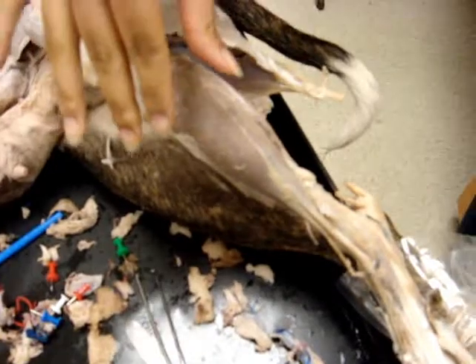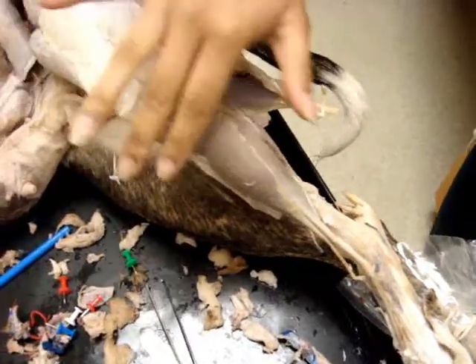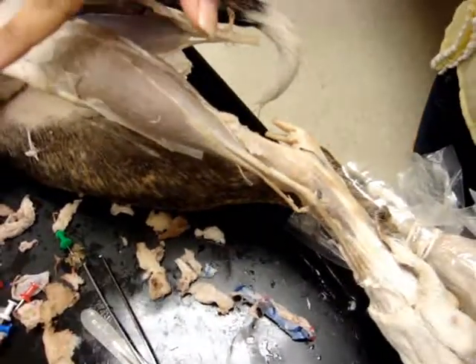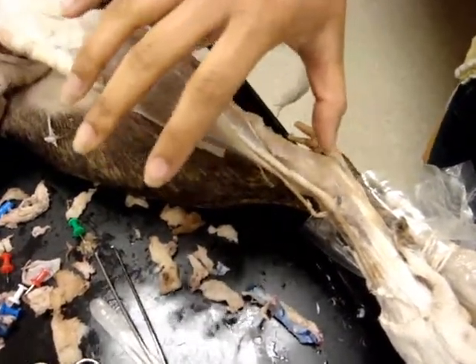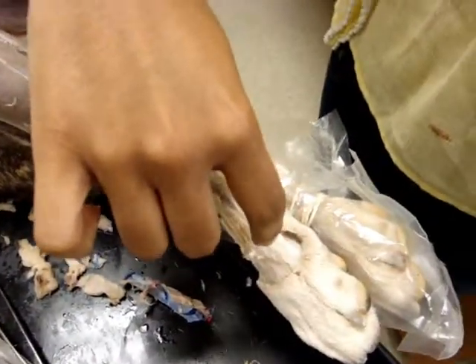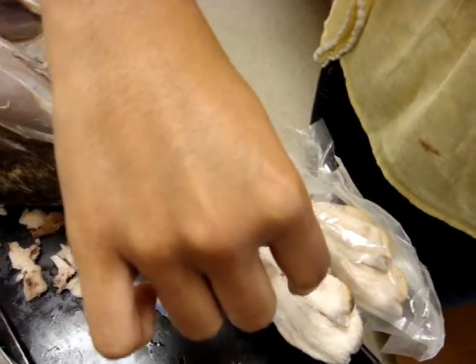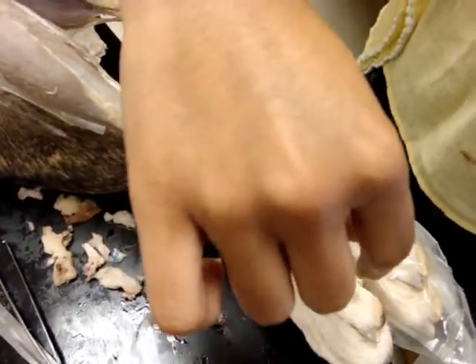We have now moved down to the crus, or the lower leg. The lower leg is covered with superficial fascia — specifically the superficial crural, tarsal, metatarsal, and digital fascia — which are similar to the superficial fascia of the corresponding regions of the forelimb.